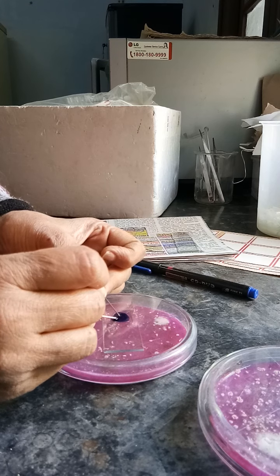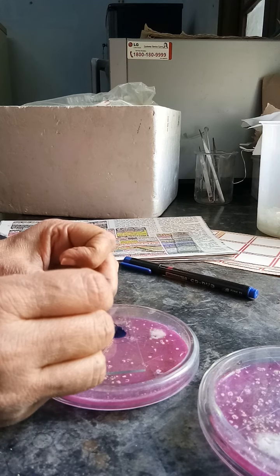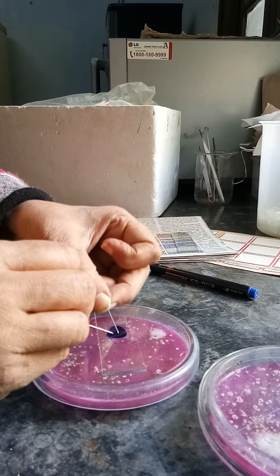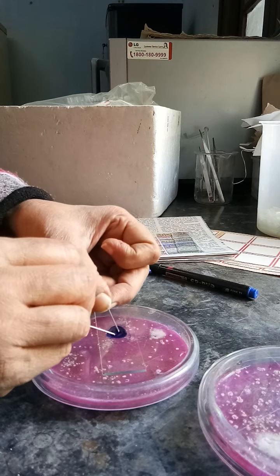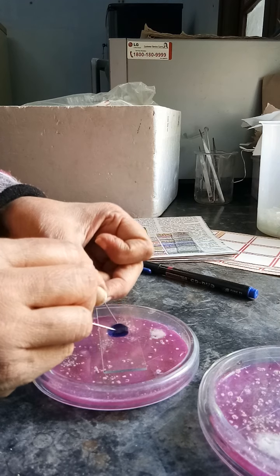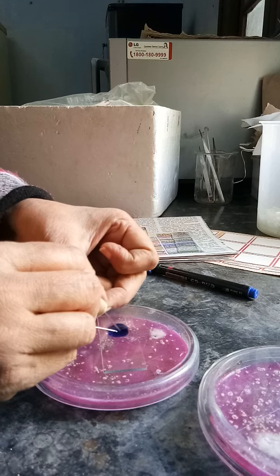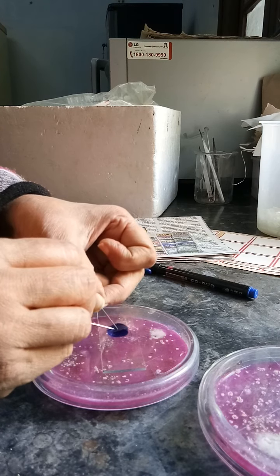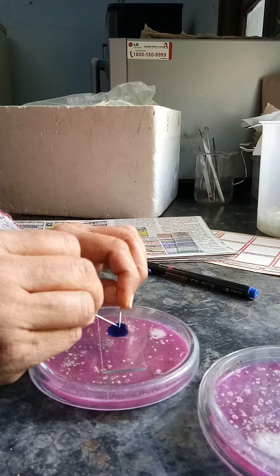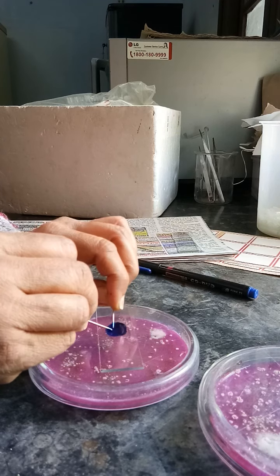Now I will put this growth into the drop of lacto phenol solution and try to separate the mycelial growth as much as possible. It will take roughly five minutes to separate the mycelial threads and it should be done with patience to give good results. If the growth is granular, you have to use the head of the pin to disintegrate the granular part. Here, because it is filamentous growth, there is no need to disintegrate it. I am holding the fungal mycelia with one pin and spreading it with another.